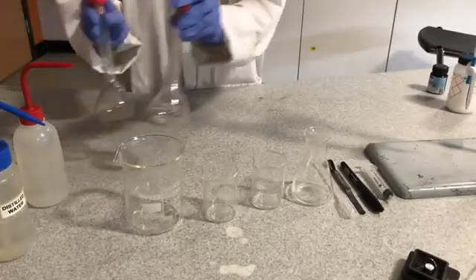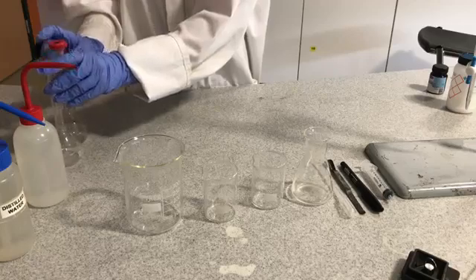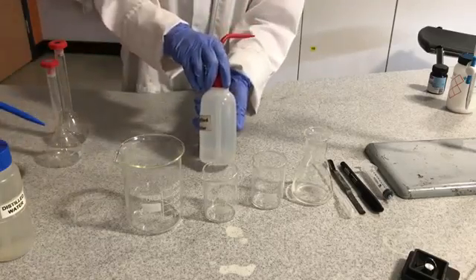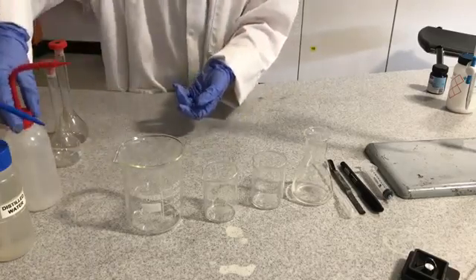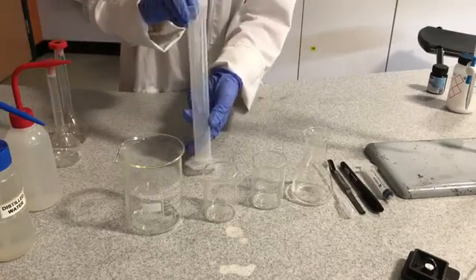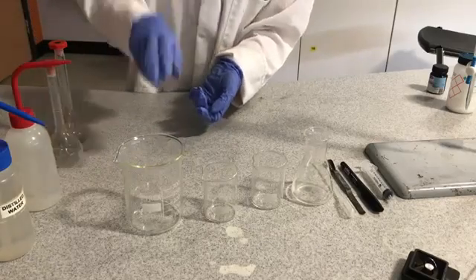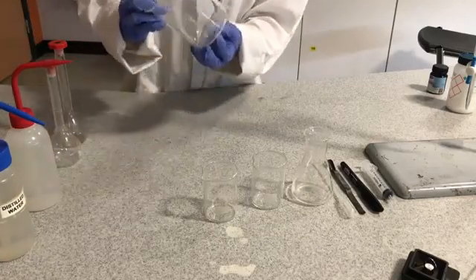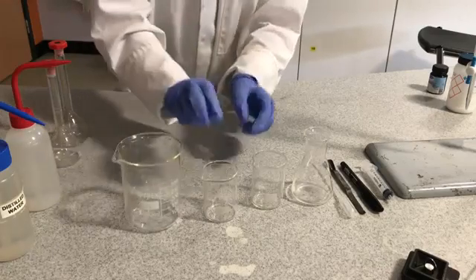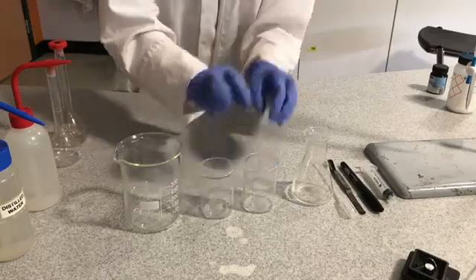The equipment required is two 100ml volumetric flasks, some distilled water, a 100ml measuring cylinder, a 400ml beaker and two 100ml beakers.